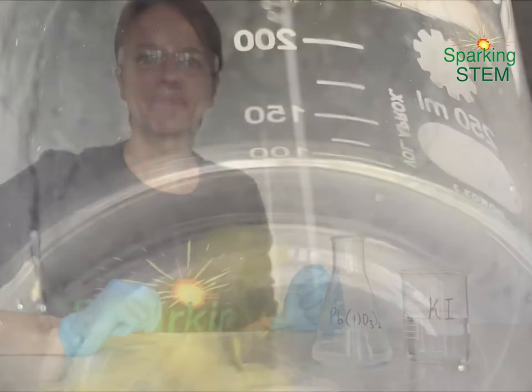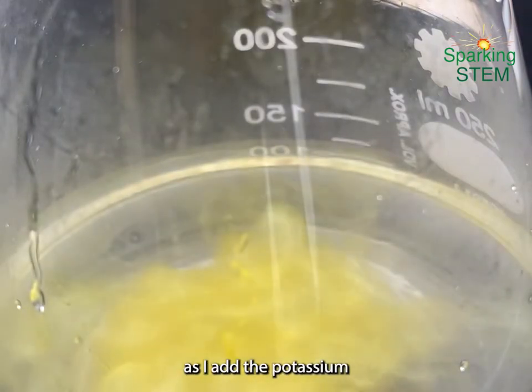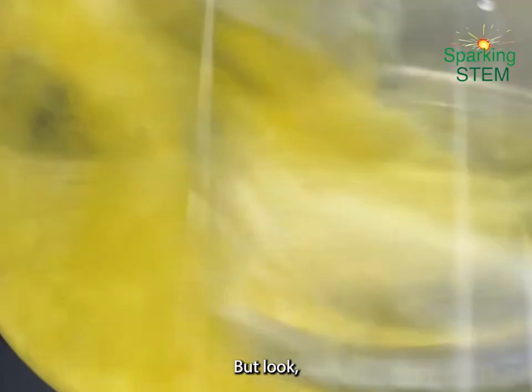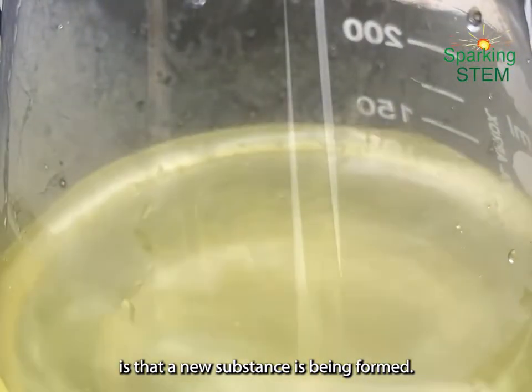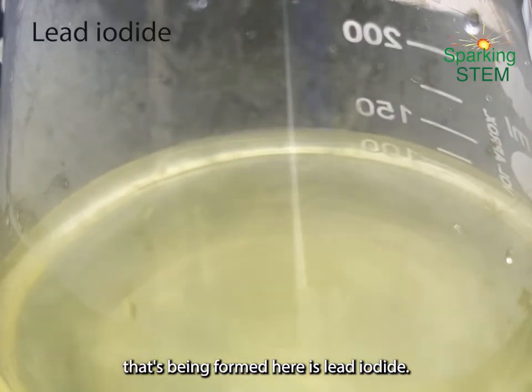Let's go outside. And here it is. Look what's happening as I add the potassium iodide to the lead nitrate solutions. They were both transparent and colourless, remember, but look, a chemical reaction is happening, and the whole definition of a chemical reaction is that a new substance is being formed. The new substance that's being formed here is lead iodide.